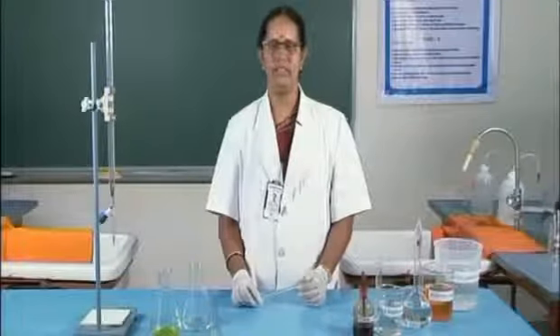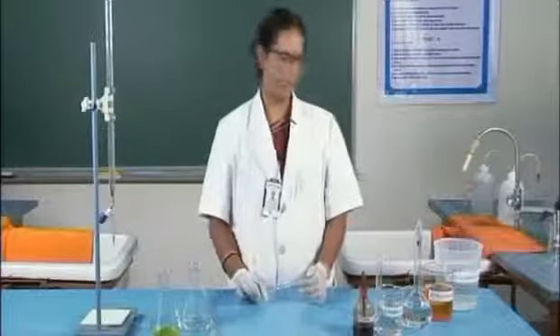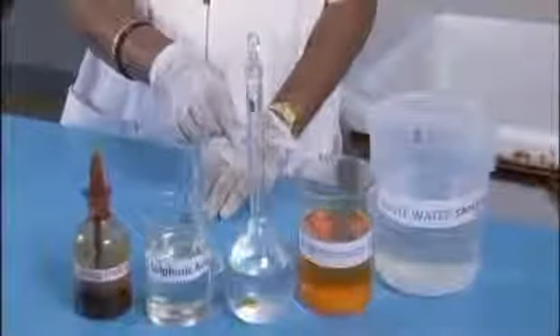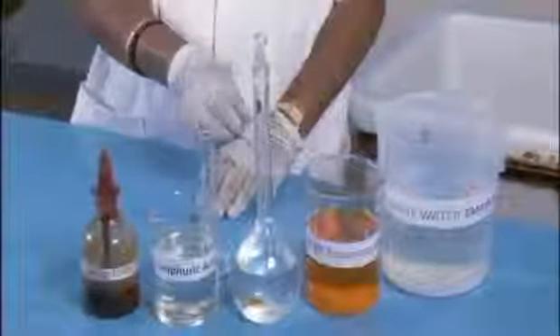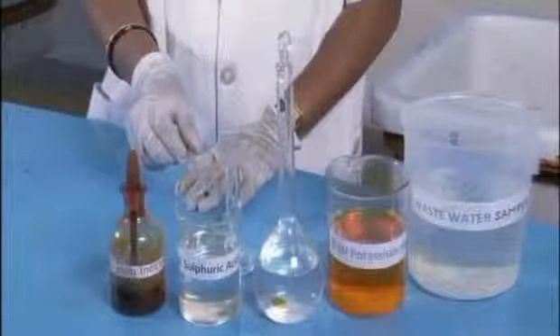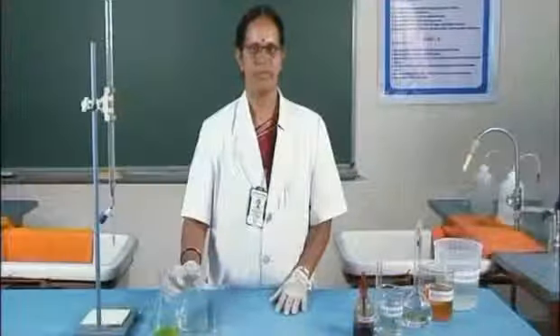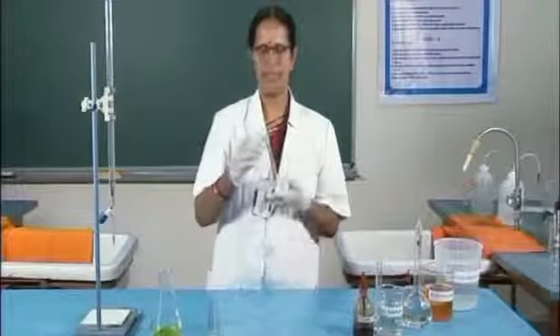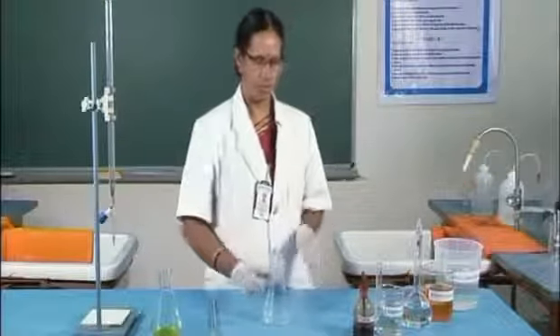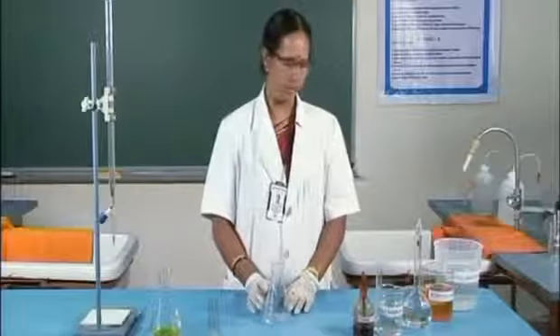Now, let us see the conduction of the experiment. The reagents required for the experiment are as shown: the water sample, oxidizing agent, the potassium dichromate solution, standard FAS solution, and 1:1 sulfuric acid. The indicator used is ferroin indicator. Now, for the experiment, the solution has already been pipetted out. To this, the oxidizing agent and the sulfuric acid have to be added.